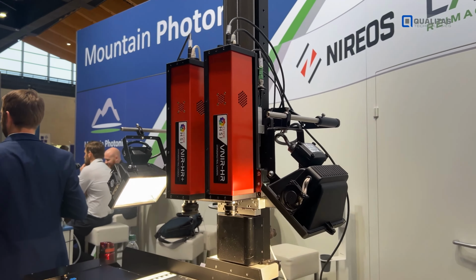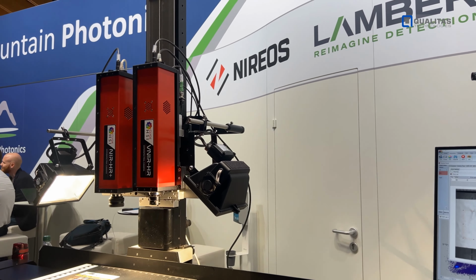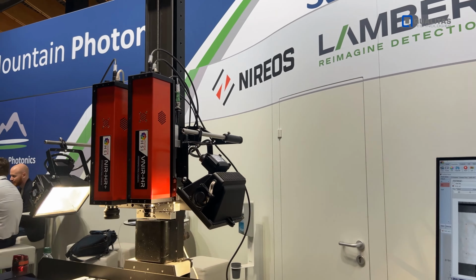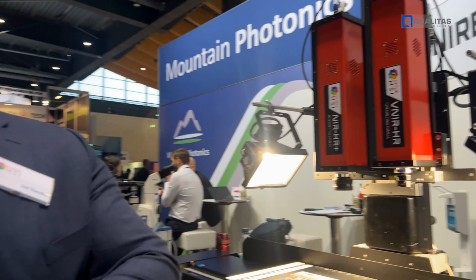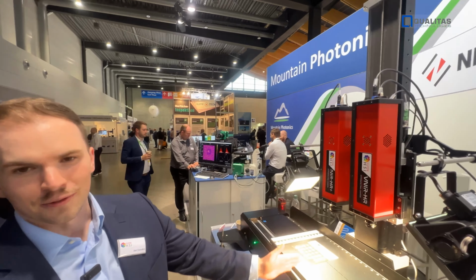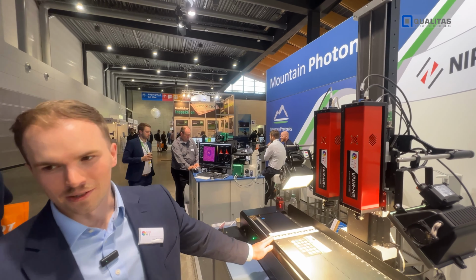So this is a pretty big camera. Tell me a little bit about why it is so big. What's inside that big box? Sure. So the configuration of a spectral camera, or actually a push broom spectral camera. Push broom is an industry term for line scan. We're measuring one line frame at a time, so that's why the sample translates under the camera.